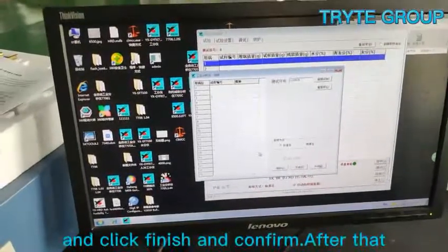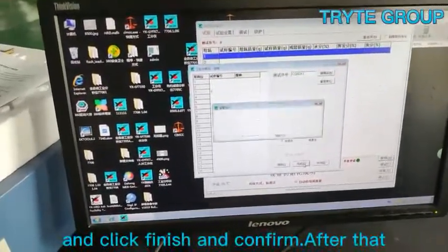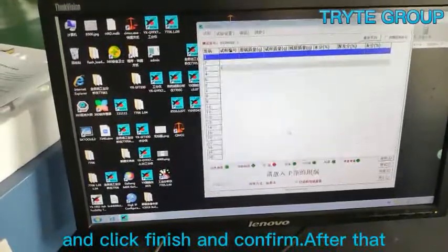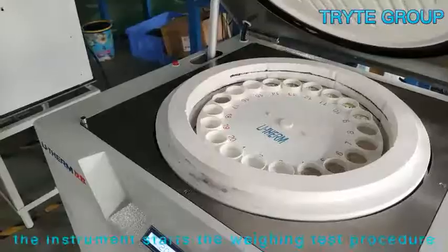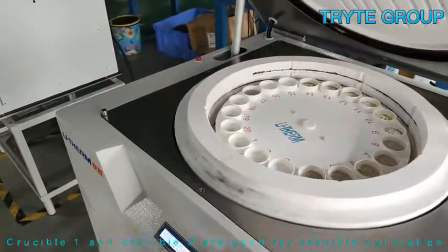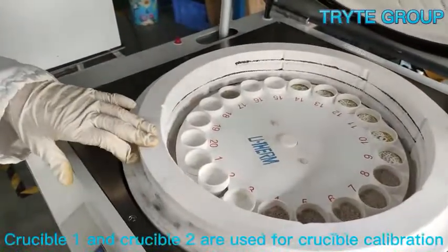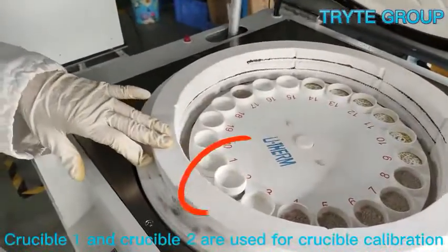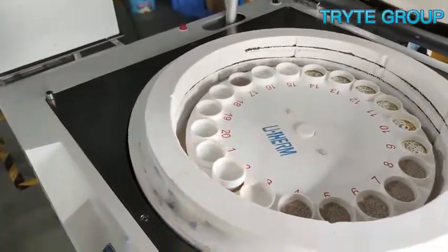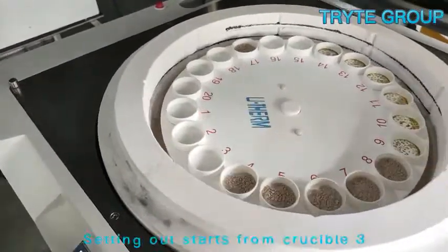Click finish and confirm. After that, the instrument starts the weighing test procedure. Crucible 1 and crucible 2 are used for crucible calibration, so it is not necessary to put samples in them.